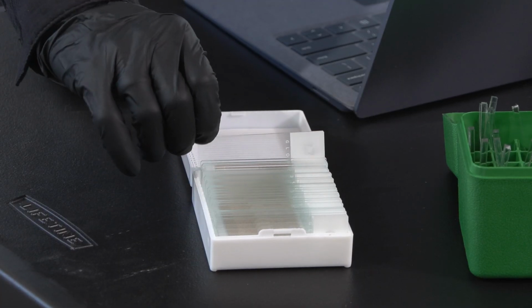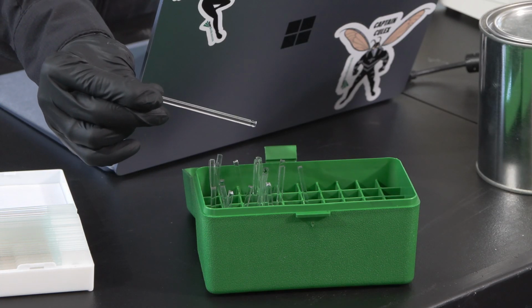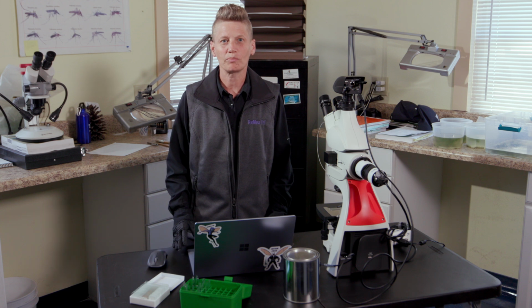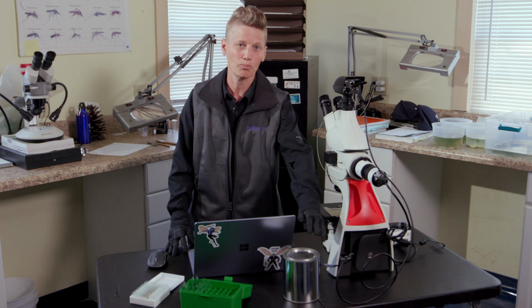A-Drop can be used with both a 1-inch slide or a 3mm acrylic rod to ensure that the spray droplets can be identified from other droplets and debris on the slides or rods. A UV dye is added to the product prior to application. Typically, it is added at a ratio of 2 grams per liter of product.